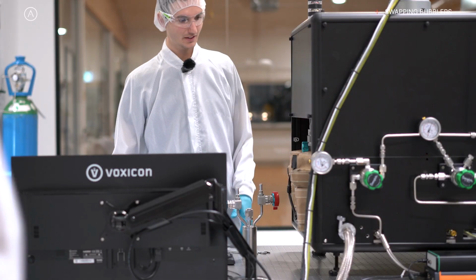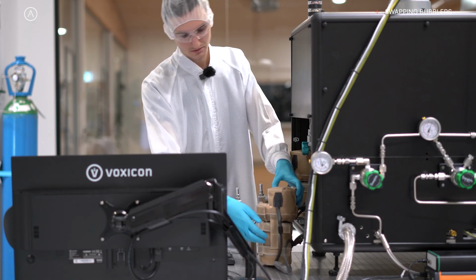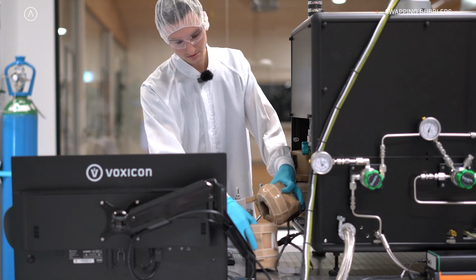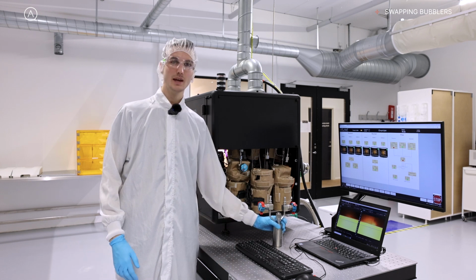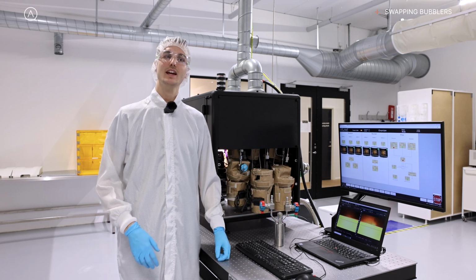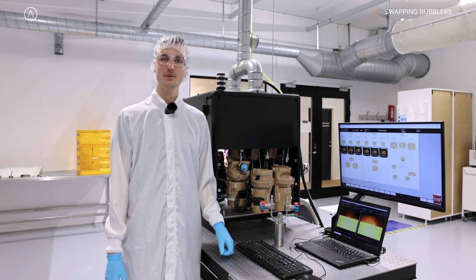So for the R&D market, when you're doing precursor development or process development, it's very convenient to do a lot of material tests or a lot of precursor tests in a rapid fashion, so you can have expedited development and progress. So being able to easily swap in and out bubblers makes it quite convenient and quite time effective for trying new materials and different precursors.